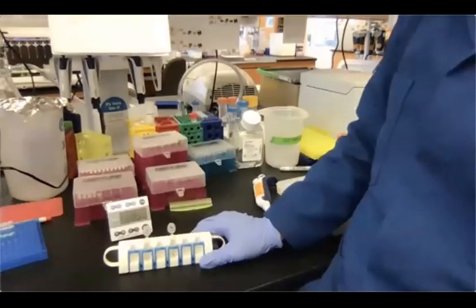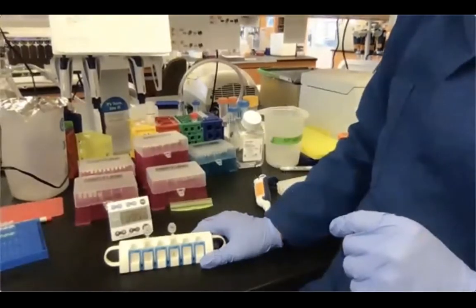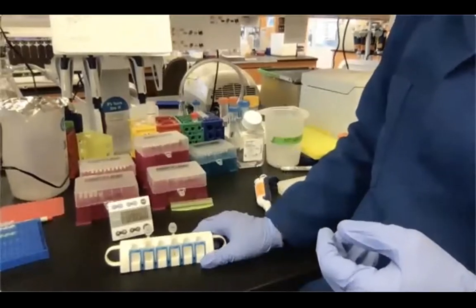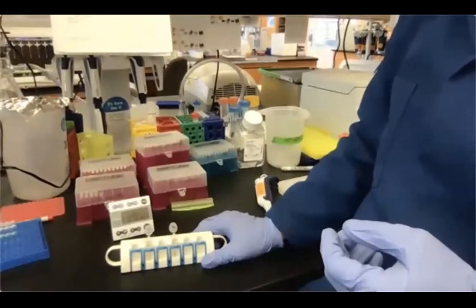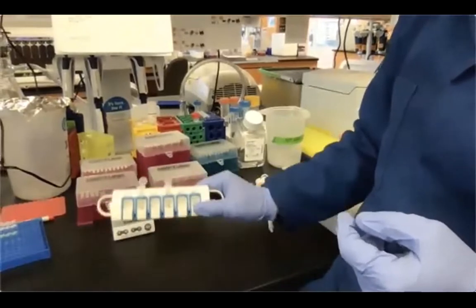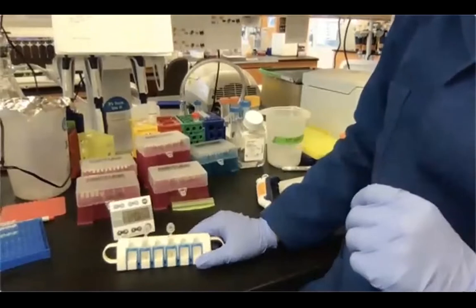The drying time of the beads is really important for 2 different reasons. First of all, you want to remove as much ethanol as possible, so as not to have some ethanol carry over in your next reaction, which will inhibit it. And also, you don't want to over dry the beads. If you over dry the beads, the resuspension with the elution buffer, which is the next step, is not going to be as efficient as if they are correctly dried. Okay, so you just want to get the timing right.